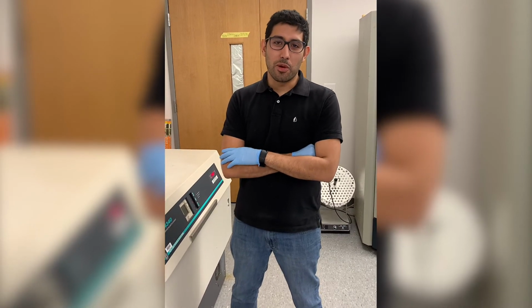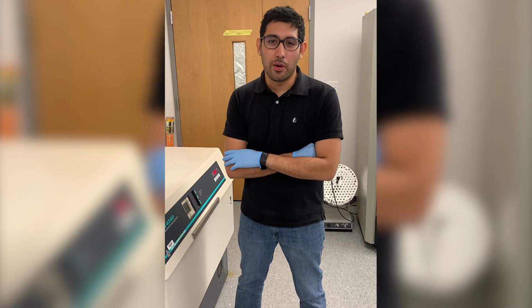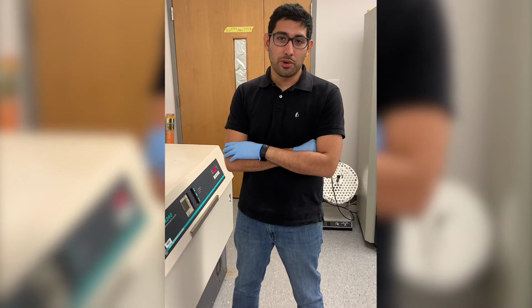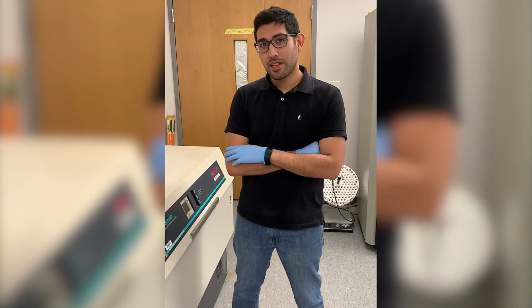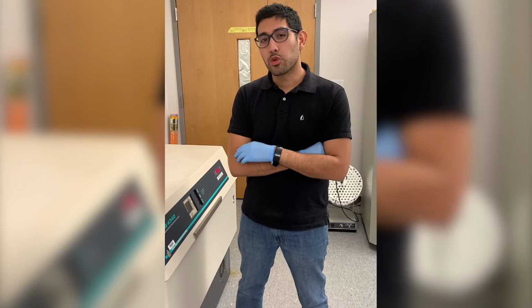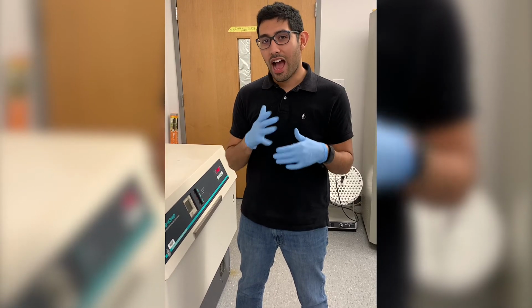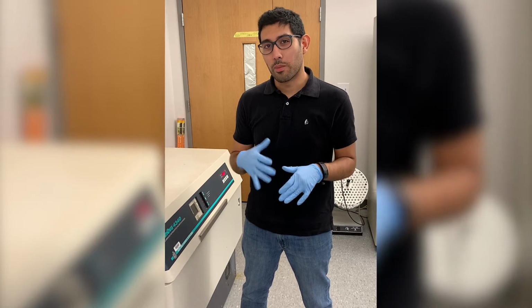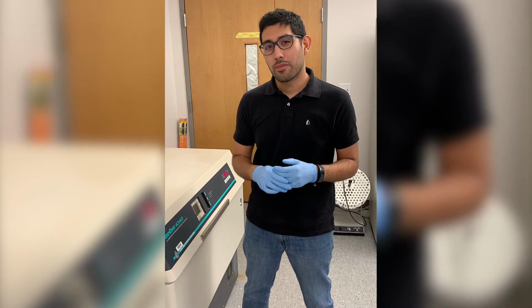I have been working on my PhD with algae and cyanobacteria with the aim of producing chemicals and biofuels. And today I am going to show you a little bit of how to work with algae and cyanobacteria to obtain these chemicals that you normally would take from oil.